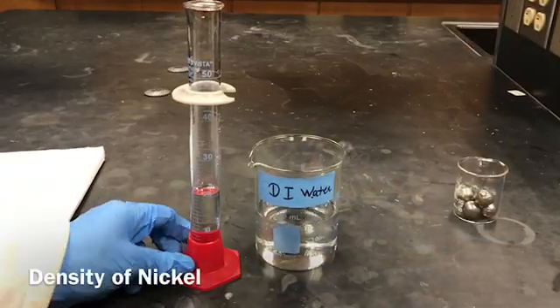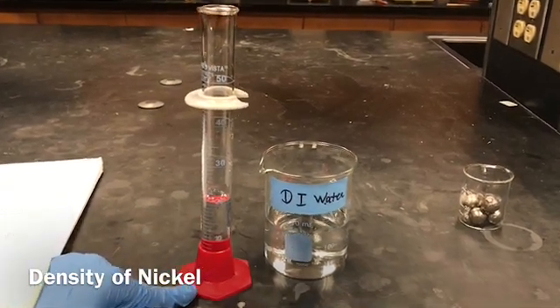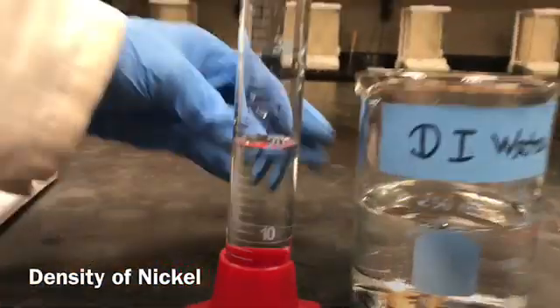Now I added about 20 milliliters of DI water into the measuring cylinder. You can note down the reading.